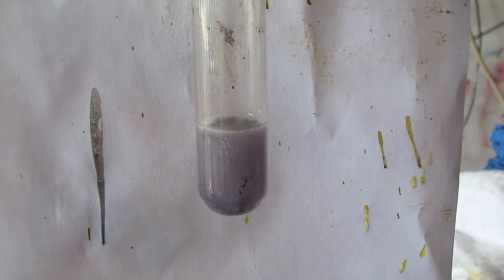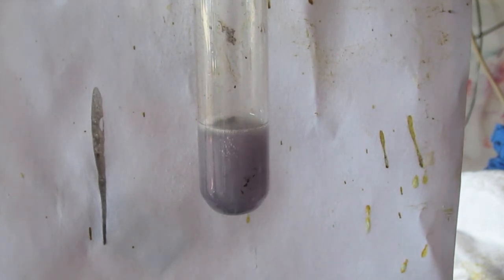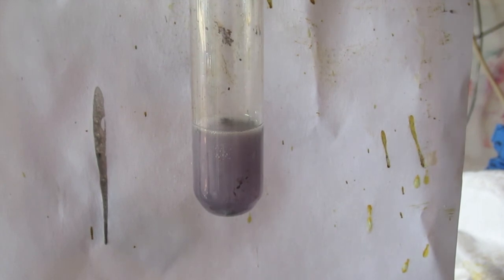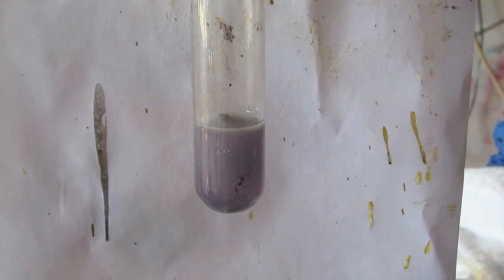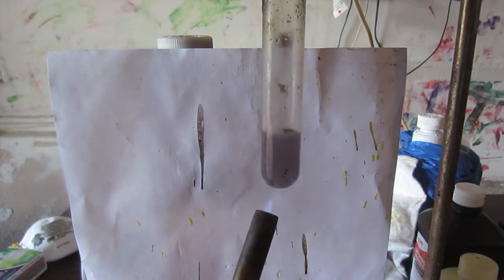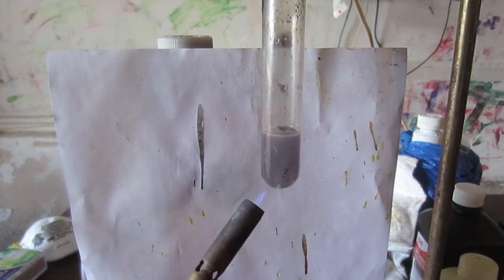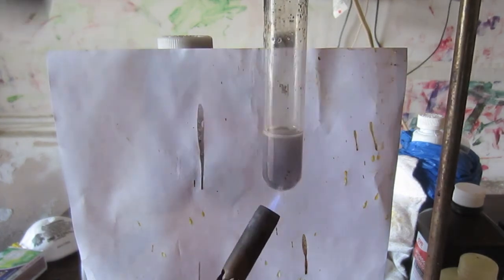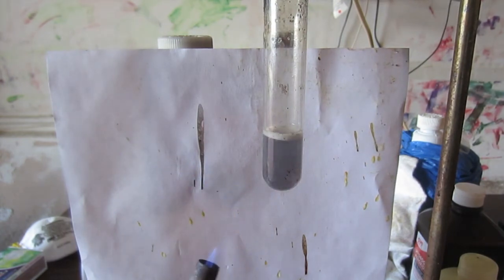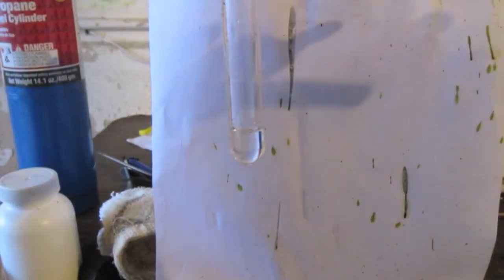And this is after a couple hours. You will see that it is not as deep as you can get with a metavanadate ion, but it is still definitely vanadium 2 plus. One thing you should know is that upon heating or even just leaving it out in the air for a while without any zinc in it, the vanadium 2 plus will oxidize to vanadium 3 plus. So, be careful of that.